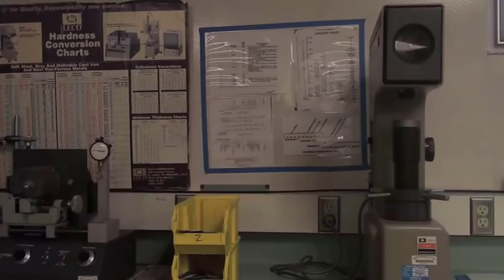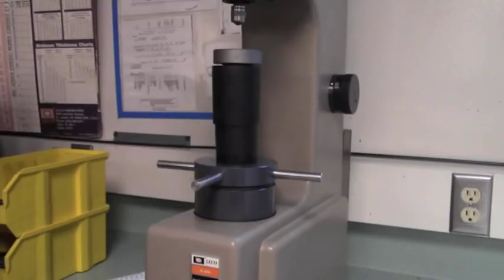Warning. Proceed with caution. This machine uses enough force to cause harm to the human body. Do not start the machine with body parts in between the anvil and the indenter.